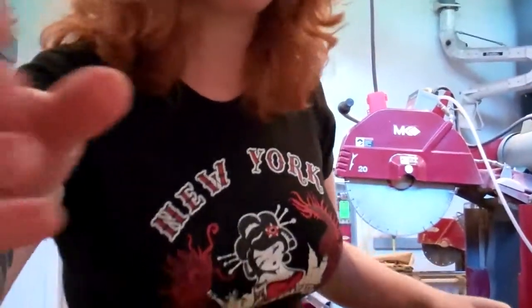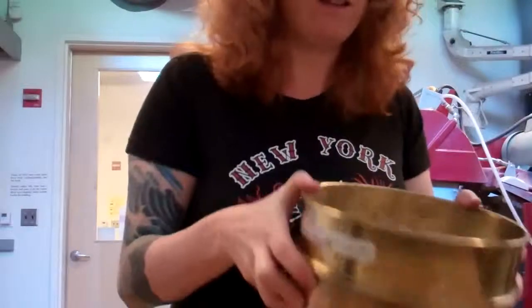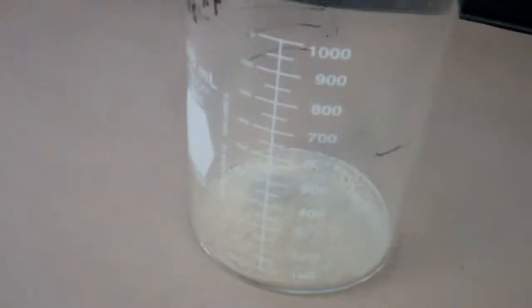So now I'm going to take this finer stuff and put it in this sieve — this is 125 micrometers. Everything smaller than that is what we don't want. We want to get rid of what's smaller because it's probably clay particles, which is not what we're looking for. So here we go again. Sifting the finer stuff is a little trickier — the holes in the screen are so tiny, it seems to take a little bit longer, but we've got some clay. Check it out.